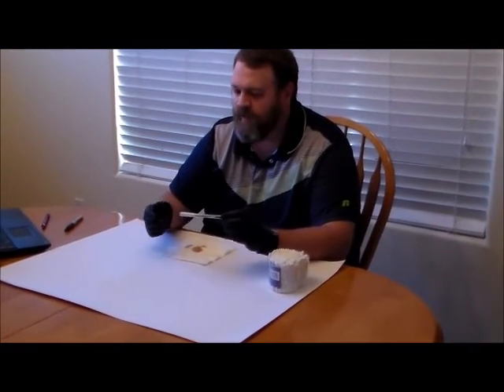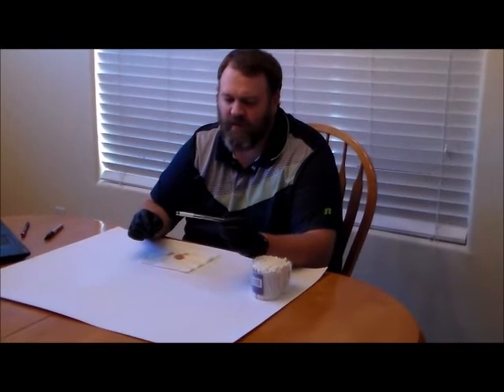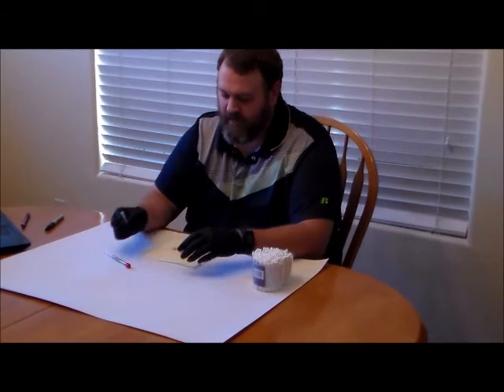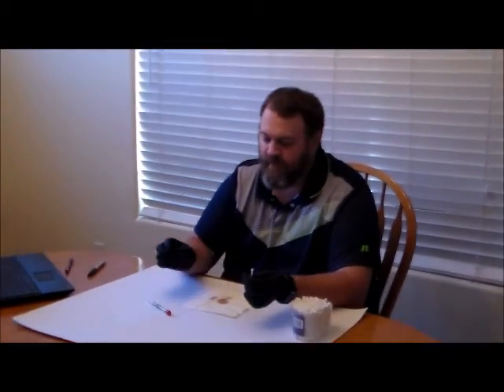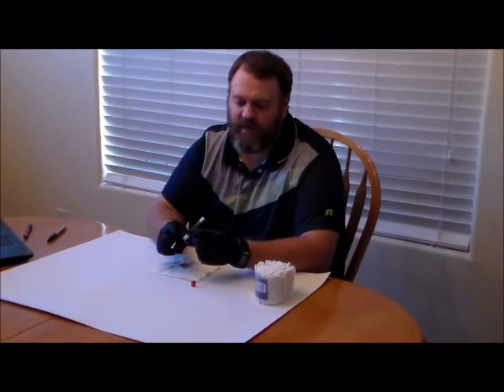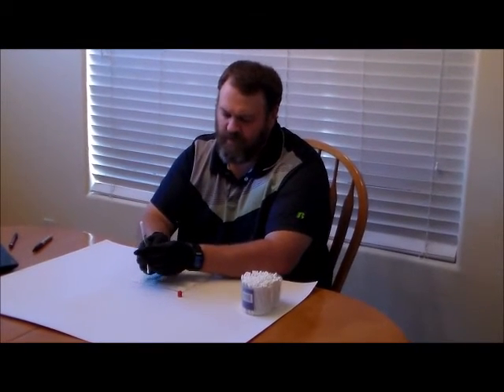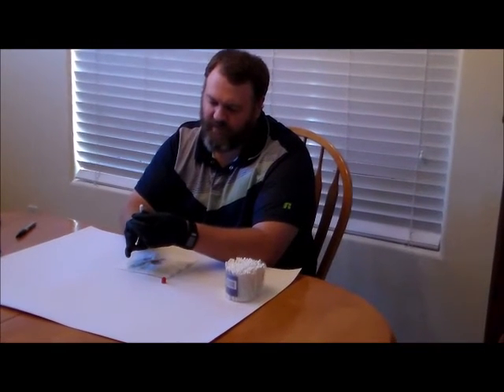We've been using these leukomalachite reagents a little differently than they're used in the field — we actually dumped the contents into a test tube. I want to show you quickly how they're actually used in the field. I have a synthetic blood stain on my napkin here. I'll collect a little bit on the end of the swab, then use the reagent vial. What we're going to do is take the cap off and squeeze to break the inner vials inside to mix the reagents together.